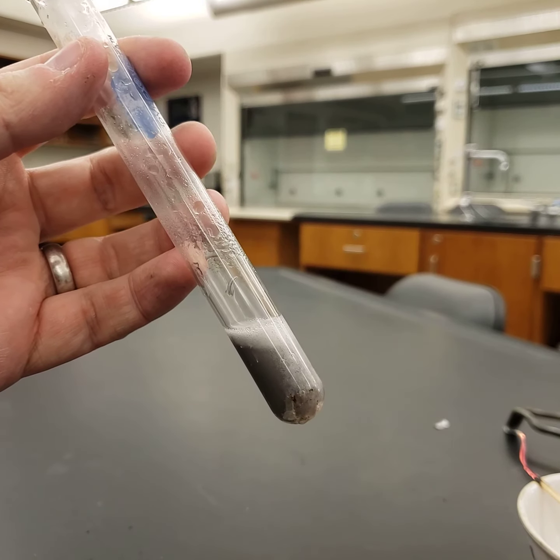Are you guys ready? You guys see that? Let's see if I can get another one — it still seems to be reacting at a pretty good pace, so I'm probably getting a good burp out of here. Here we go, ready? So that's the magnesium with hydrochloric acid.